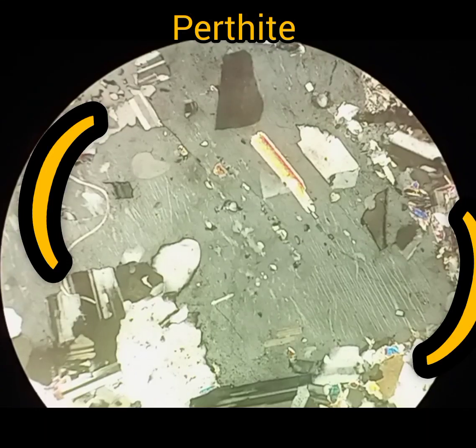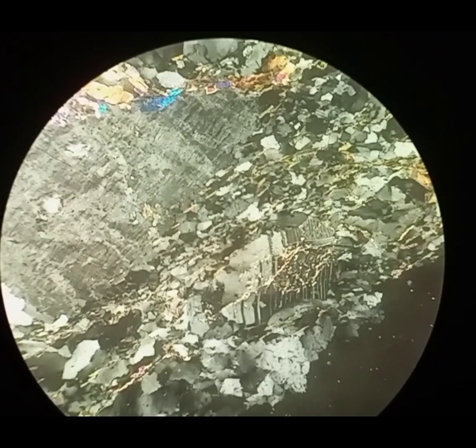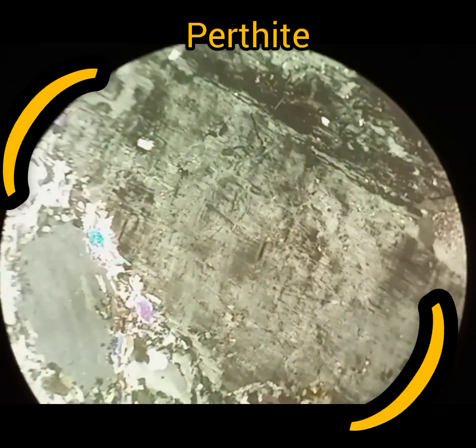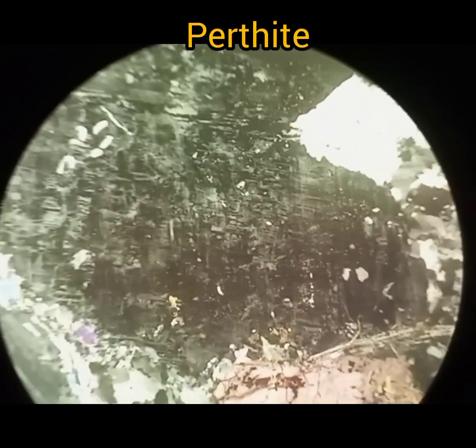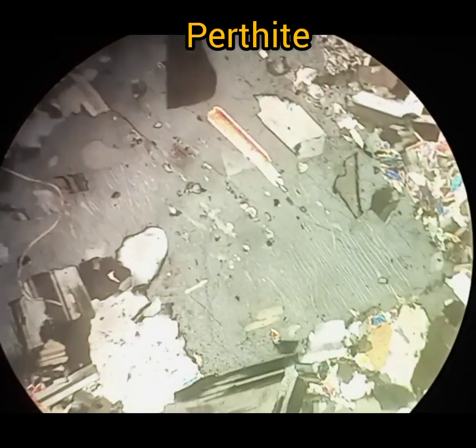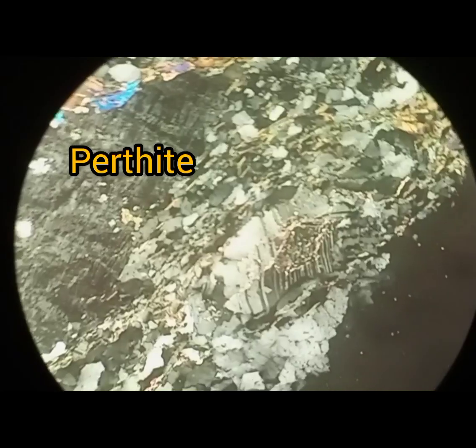Perthite is an intergrowth of two alkali feldspars: sodic feldspar albite and potassium feldspar orthoclase, also known as perthite twinning. A host grain of potassium alkali feldspar that contains irregular intergrowths or exsolution lamellae of sodium alkali feldspar is called perthite.